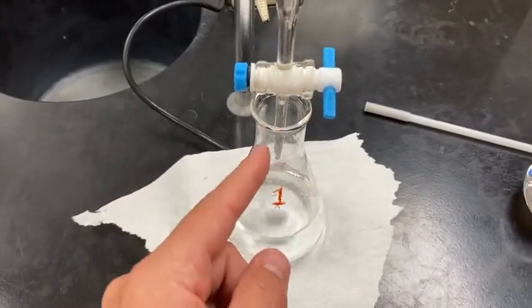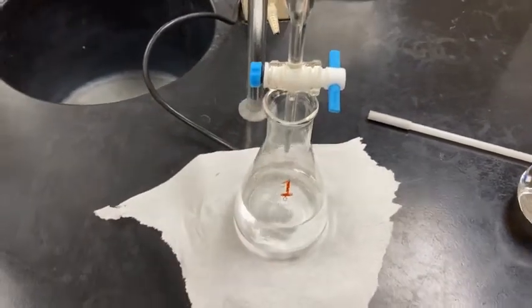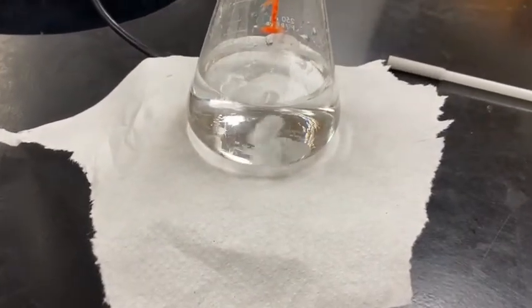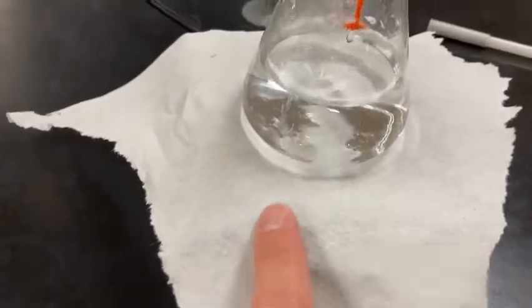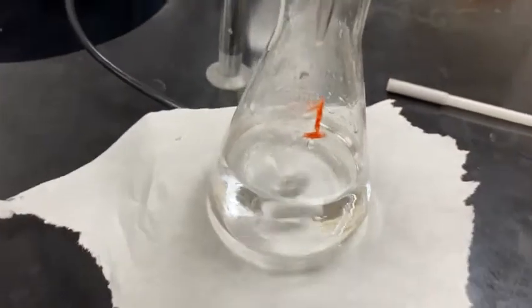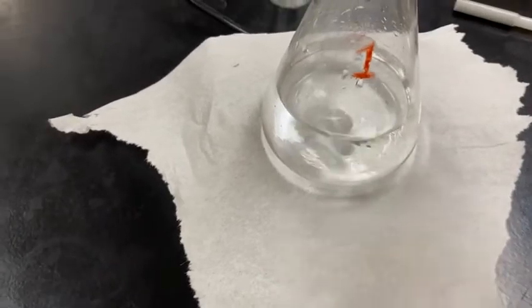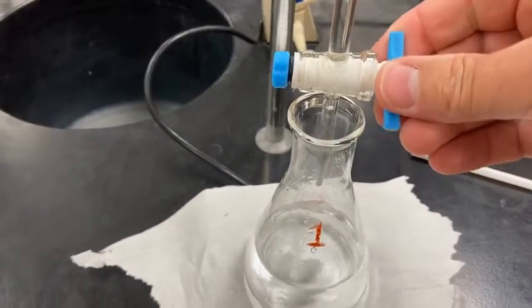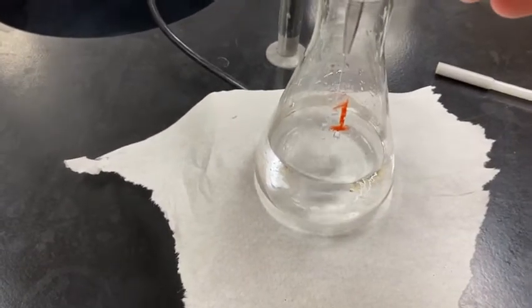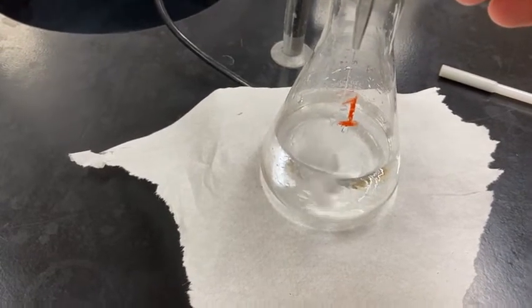That way as it mixes, the drops that come out won't accidentally splash down the side and we miss volume data that way. The stir bar is in full motion, and you notice I put a piece of white paper towel in between the flask and the stir plate underneath. This is to allow us to see that pink color a little bit easier with our eyes. So I'm going to open up the valve and start adding the base. And we're going to watch for that pink color to persist throughout the whole solution.